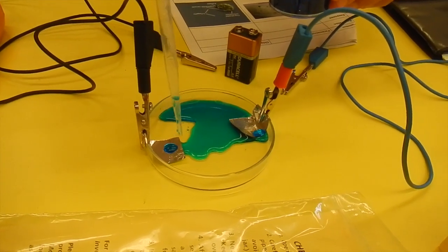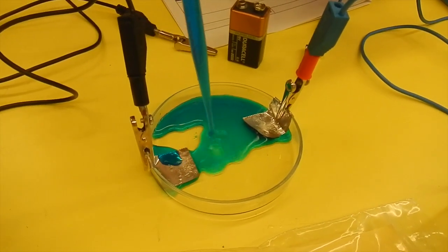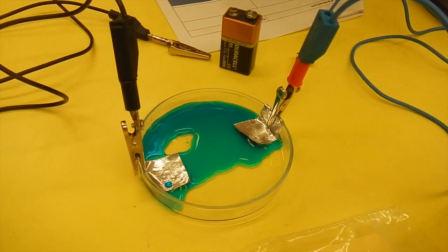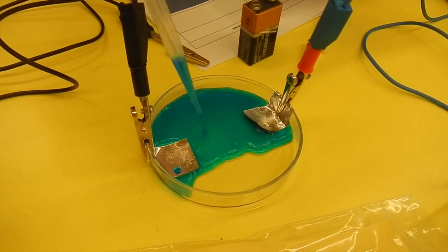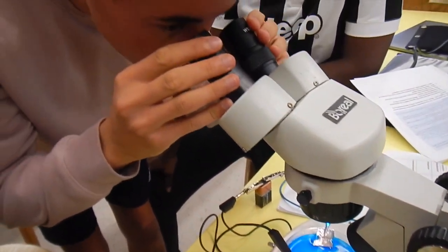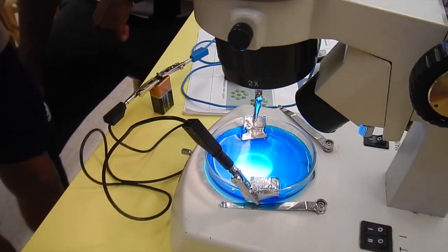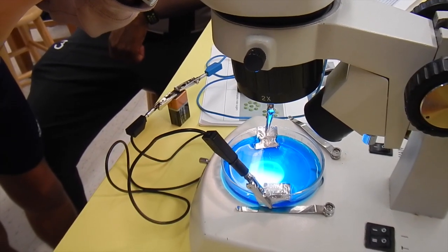We're putting the sample, a thin layer, in a petri dish, and the petri dish has two electrodes, a positive and a negative, and they're made of aluminum foil clipped on with the alligator clips. And then going to put a low voltage supply through, and then watch to see if there's a stimulus response from the Paramecium, and can you see them moving in one direction or another. Oh no, I see them.